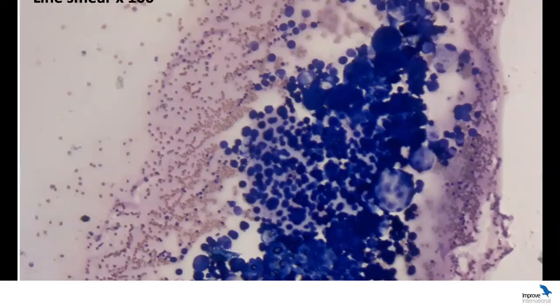So this case is another one that points out a common mistake that people often make when they're starting with cytology, which is to go straight for the oil magnification and look at all of the smears. There were a couple of people that, even though I'd pointed out during the practical session that it was a line smear, still tried to look at these cells in that middle area. And when you have these concentrated, it's a good idea to go and look there.